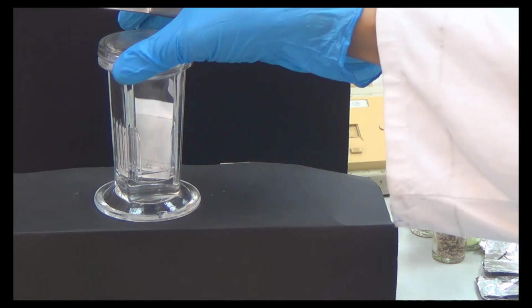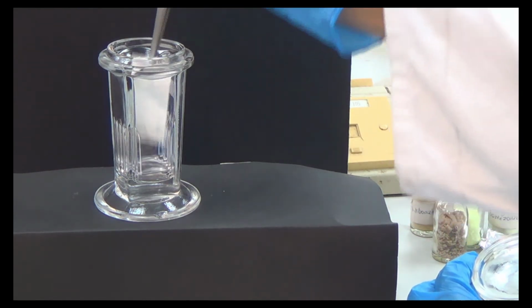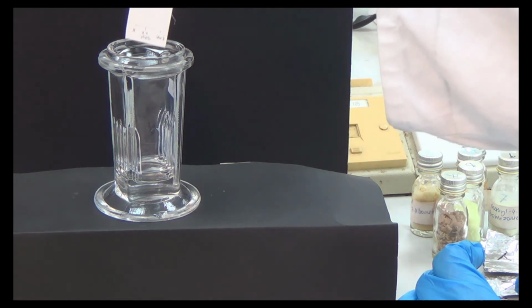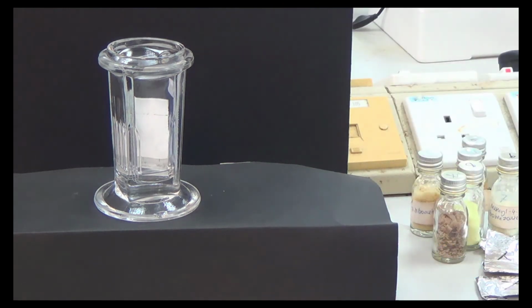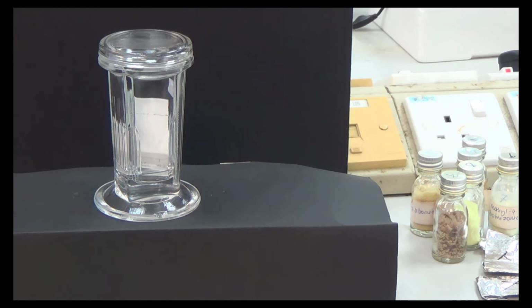Oh, by the way, about the bonus mark, I will check again. So now it's on the top. About the bonus mark, I will check the names later after we finish. Because I recorded this, that's okay. Later on, I will see who answered and so on. So now this is the last one, the last for the X. So we put it there. Okay, again, and we close that. So now I think you can see. Let me check. You can see or not? I think you can see it's moving up, right?